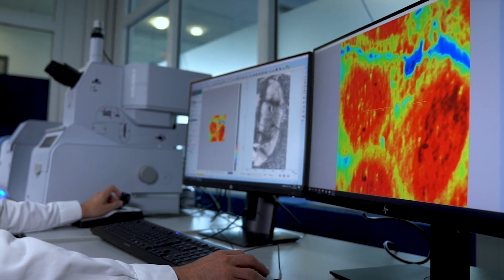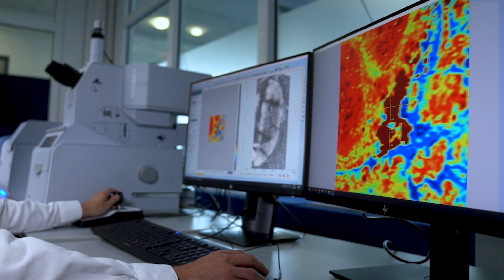This allows us to integrate advanced features into the Hyperion tool, like the stunning live IR view that lets you analyze samples in the infrared, at single wavelength, in real time and at video frame rates. With the live infrared view you can directly observe how the sample behaves in the infrared and draw conclusions immediately.